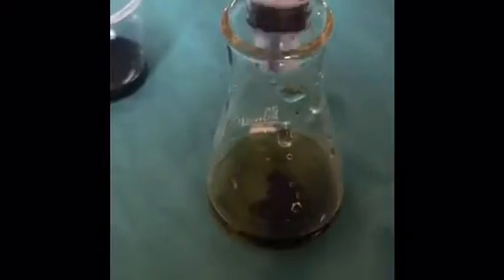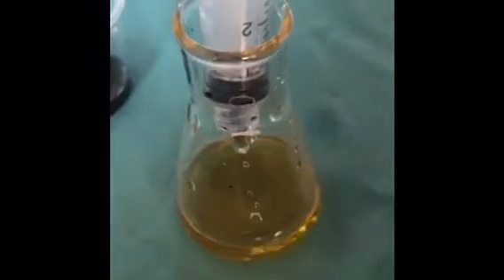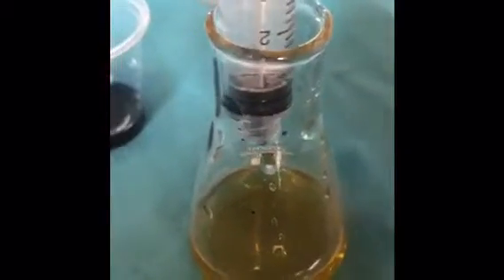And hopefully I will remember to take a picture or record the titration afterwards, so I needed to add that into my video. So here's about halfway through the titration for the 1.5 grams per liter ascorbic acid sample. As you can see, it's a little bit of a yellowish color, so I'm going to keep titrating it until it turns a more greenish blue color, which is the endpoint.